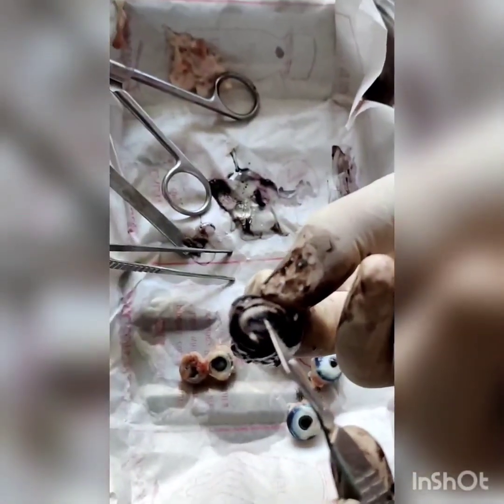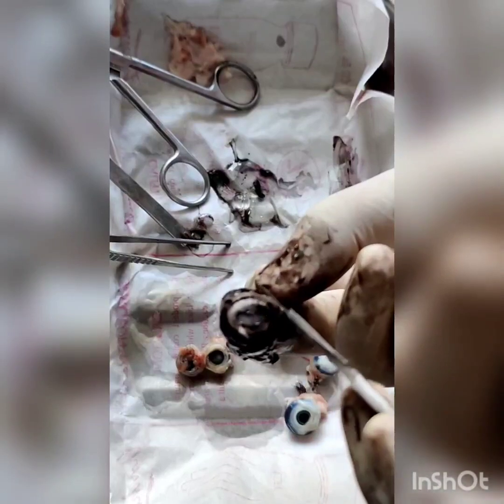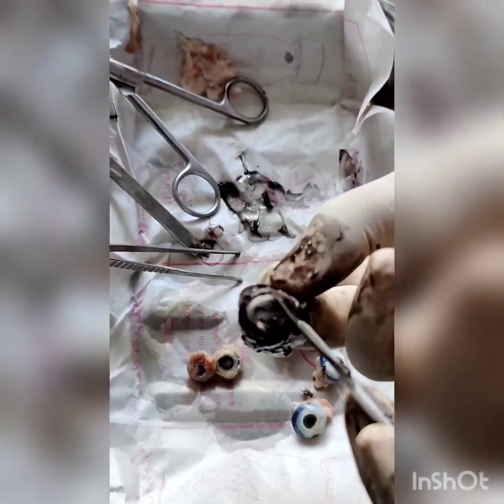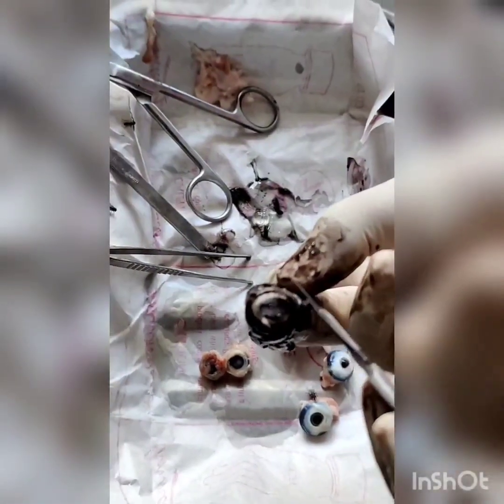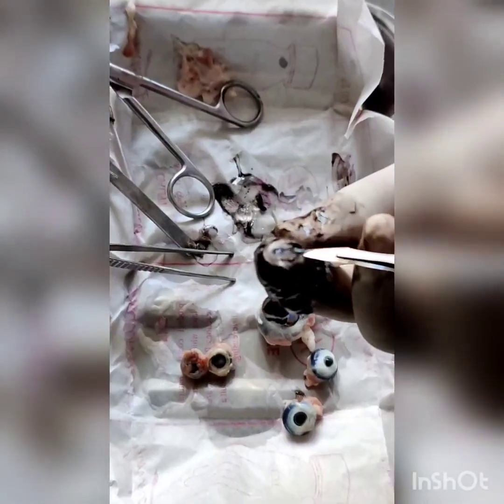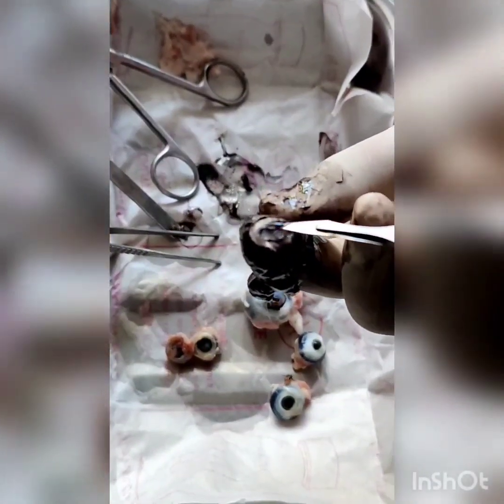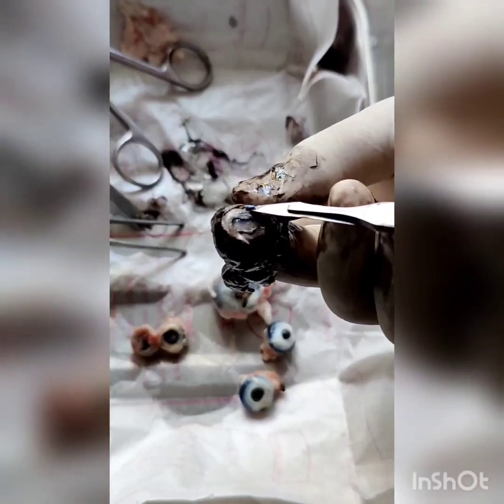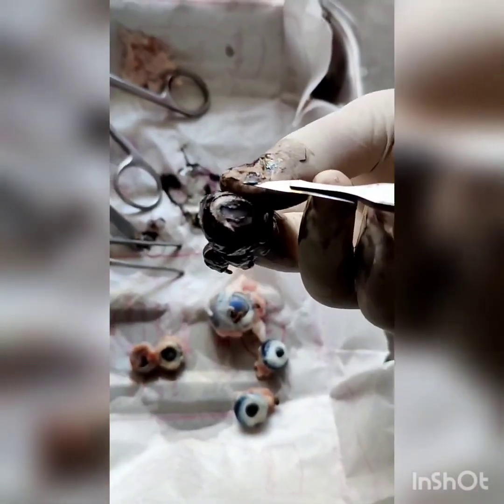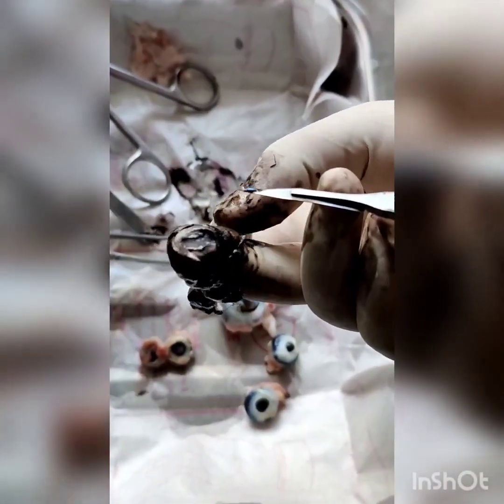These rays I am pointing to are the ciliary process. Near the ciliary process, these whitish-black grayish rose-shaped structures are the iris, which contracts and expands to control visibility.